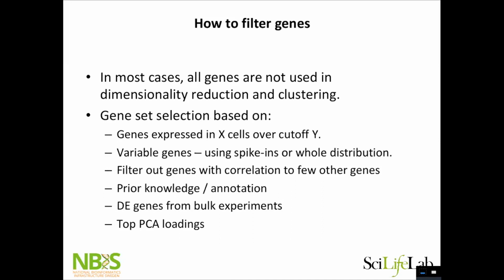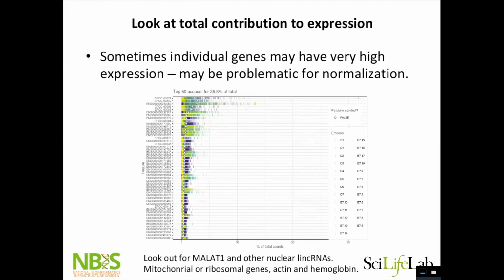Another thing is quality control on genes. I think during the afternoon we'll talk about a lot of gene set selection, finding variable genes, and so on. But there might be some problematic genes in your data set. So here is a plot with the contribution to all total counts per gene. And as you see here, this is clearly a case with a bit too much spike-in. These are the spike-in genes. They are a big proportion of all the reads. And then there's a gene here that some cells have, there should be some lines up here, like 25% of all the reads is this one gene.